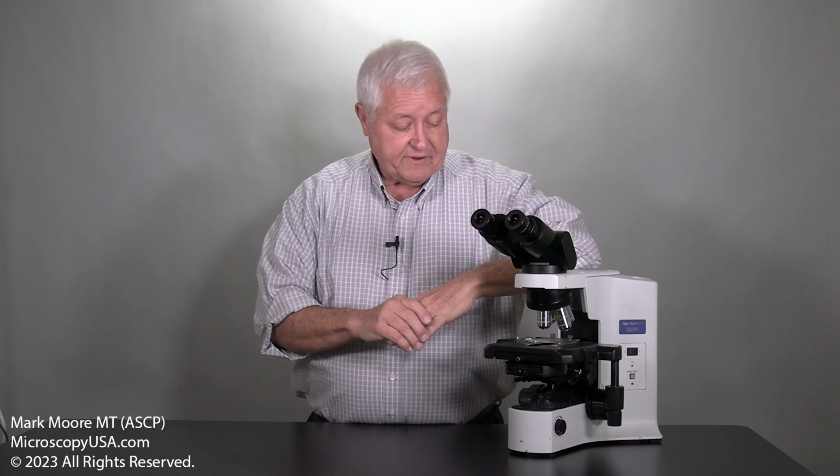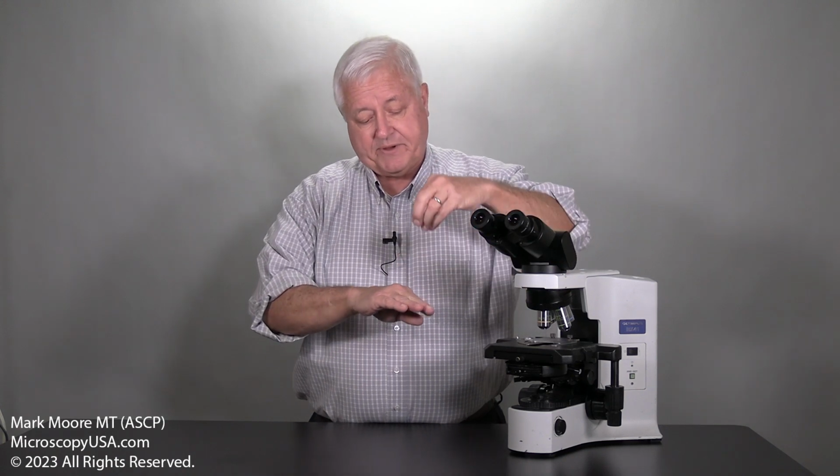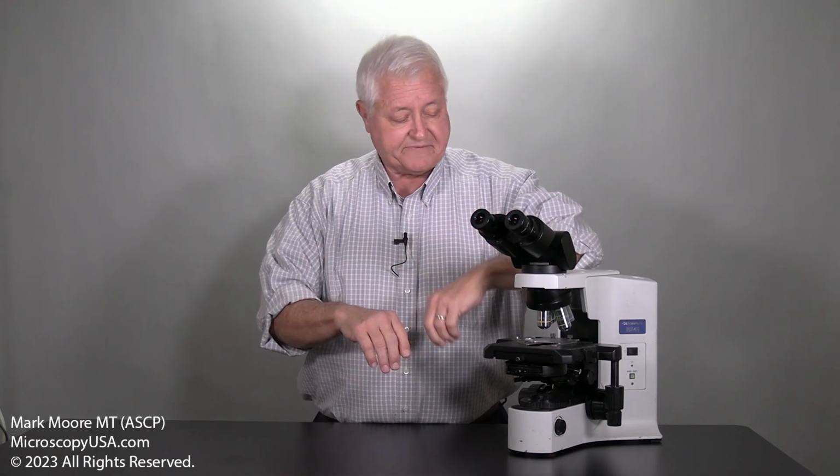Today we're going to talk about how we really understand whether objectives are oil damaged or not. If lab techs by mistake keep hitting slides with oil immersion objectives, the glue, the resin that holds the lens in place can get cracked, and capillary action can leak up inside and ruin the clarity of the image. So then the service person comes, and the techs are complaining that you're not getting sharp resolution when you look through your oil immersion objectives.